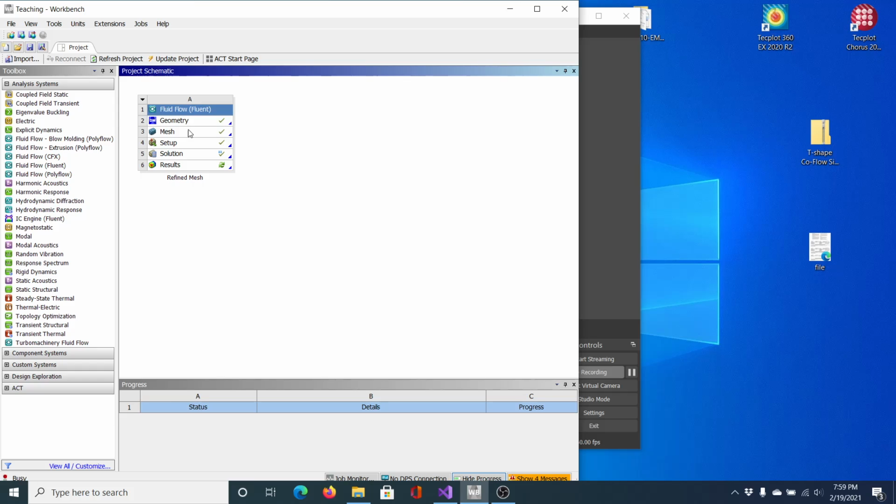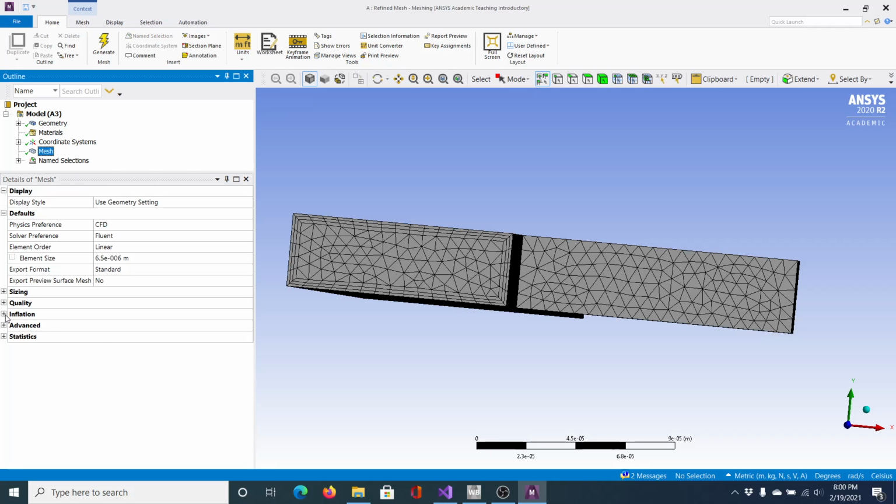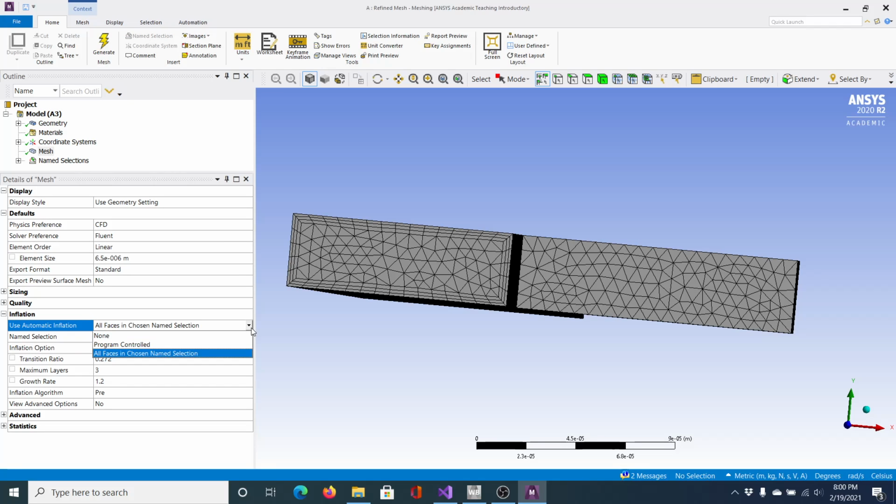So what you're going to do is go back into your mesh, and under the inflation, you're going to change this to none. So what's happening is because the mesh is refined and you do have a surface inflation, it's causing the equations in the solver to come across some errors. So this is the first one. Just change that to none. Run it as usual, like we did before, and you should get some decent results fairly quick.